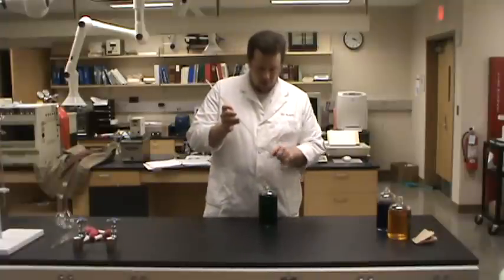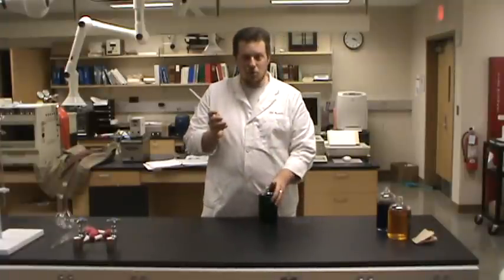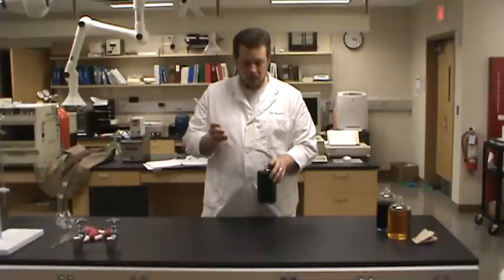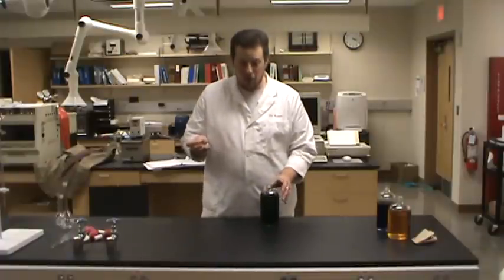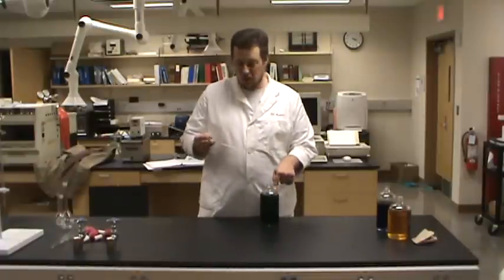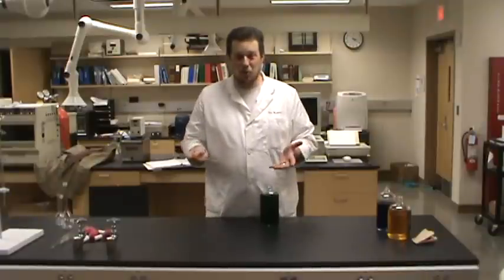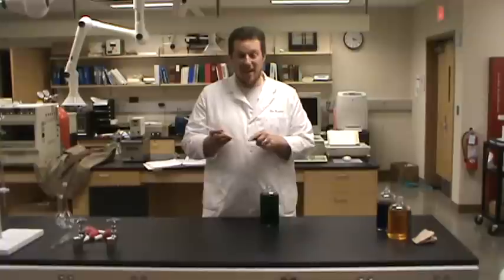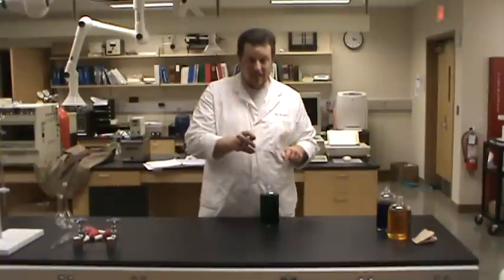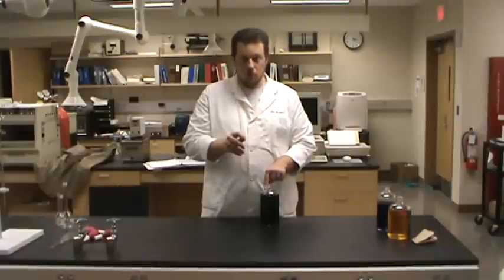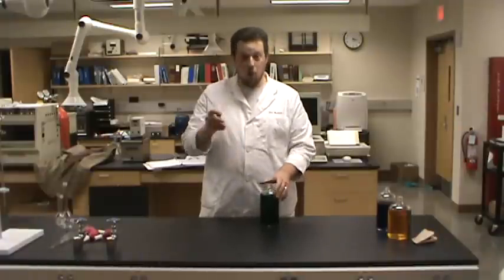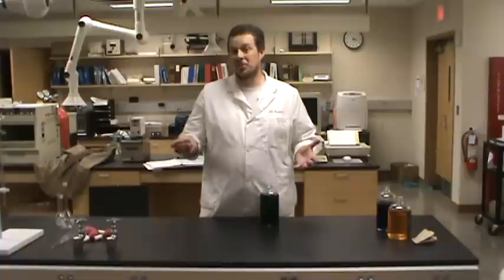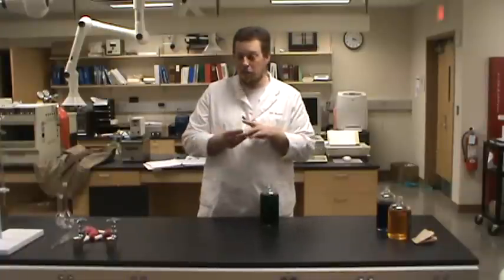Now in this case, I could probably get away with it because this is green food coloring in water and I'm not doing a real experiment. But it's better practice to never let yourself stick a pipette into a stock bottle. So we need a secondary container. Sounds like a perfect job for a beaker.